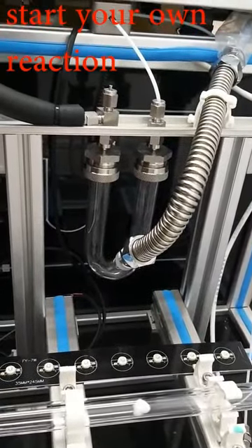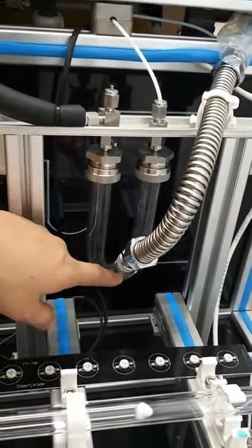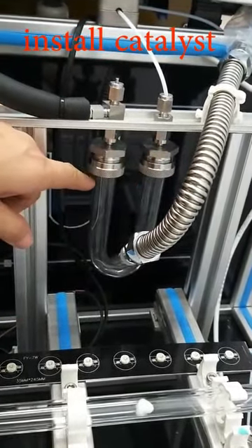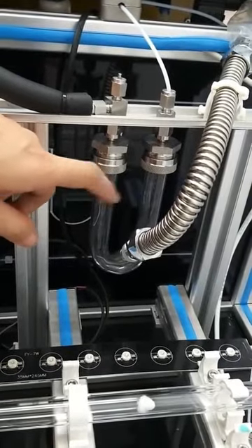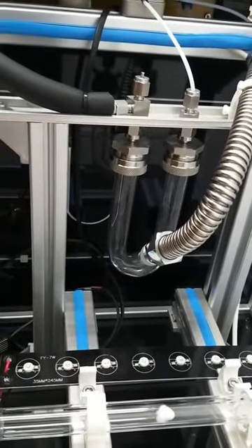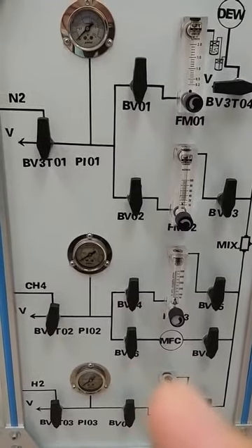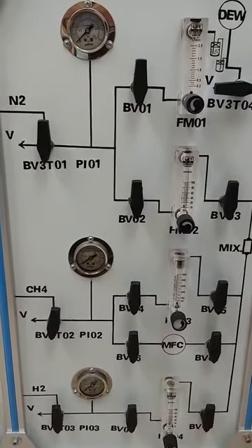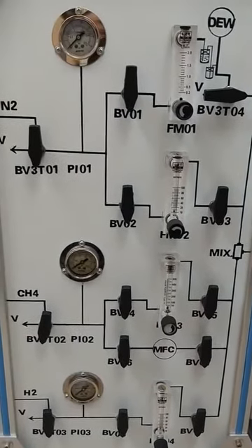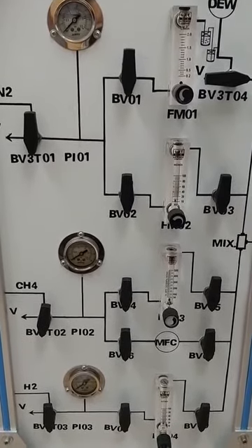To start a reaction, you can take out your reactor, fill your catalyst in, and block both sides with cotton wool to prevent the escape of your catalyst. After that, you can start preparing your reaction. Normal procedure: charge the system with nitrogen first for maybe 20 to 30 minutes to remove the oxygen inside the system.